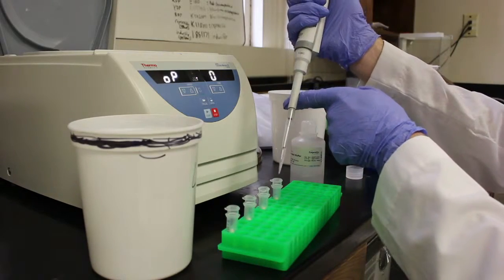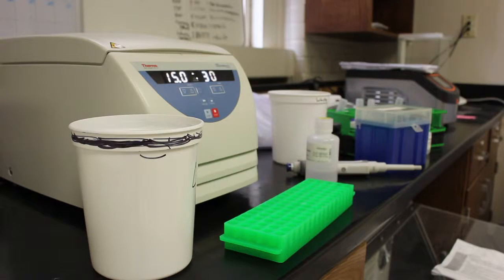Then add 400 microliters of plasmid wash buffer and centrifuge for 1 minute. Repeat this wash step.